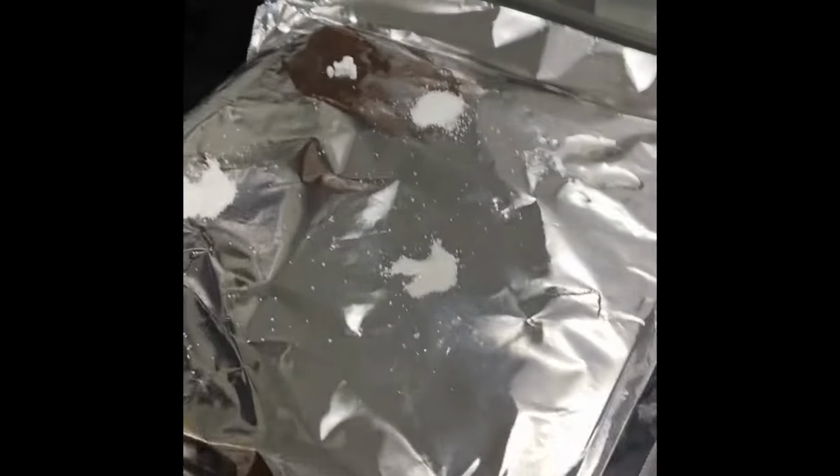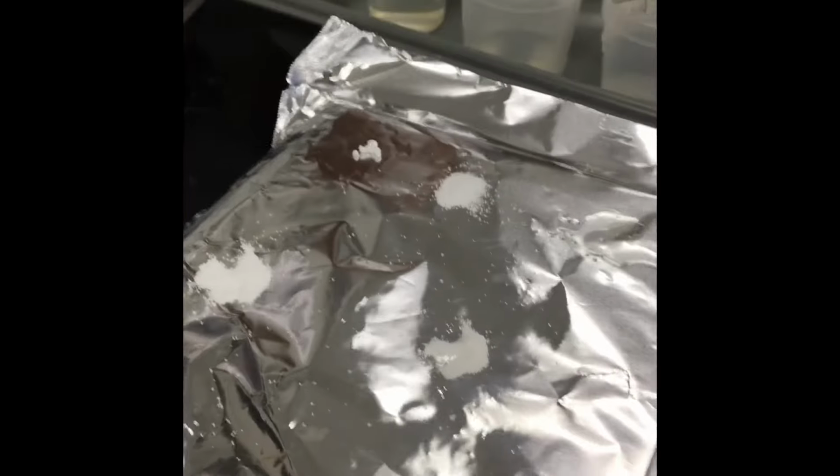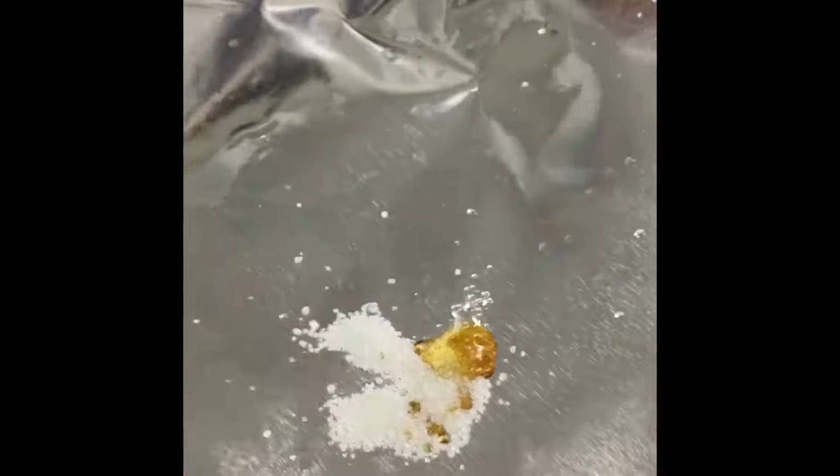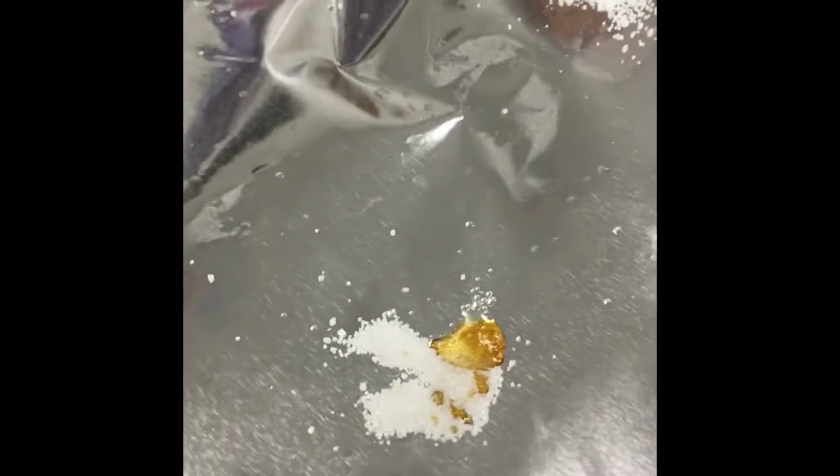And I can see that my hot plate's been on just a couple of minutes, and one of these is already melting. So that is right here. This is already melted. That is the wax. So next to my wax for relative melting point determination, I'm going to label that as number 1. It melted first. All right, so our wax is completely melted, and I see here that my sucrose, my sugar, is starting to melt, and it actually is turning into caramel. So this brown stuff here, when sugar melts, it makes caramel. So we're going to label our sucrose as number 2.